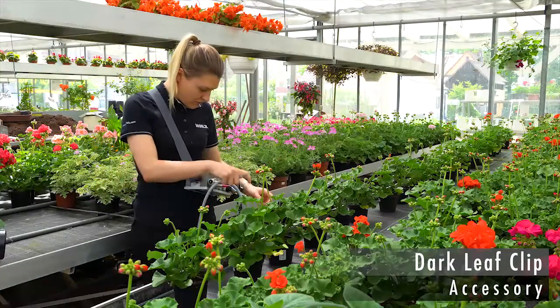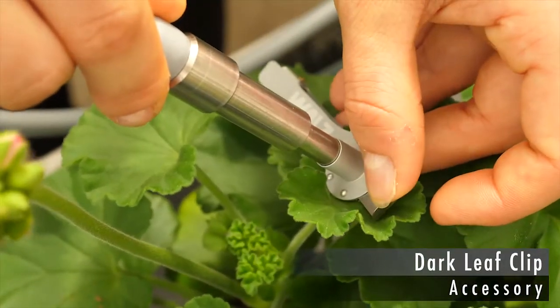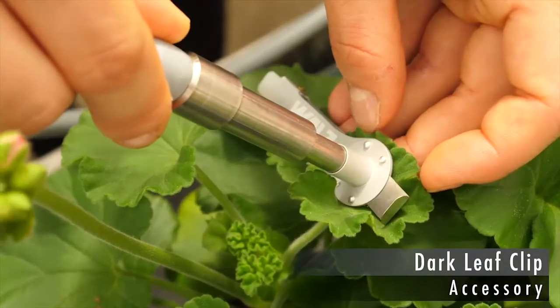20 minutes after placing the clips, Sabrina can now probe the entire series of leaves in one run.